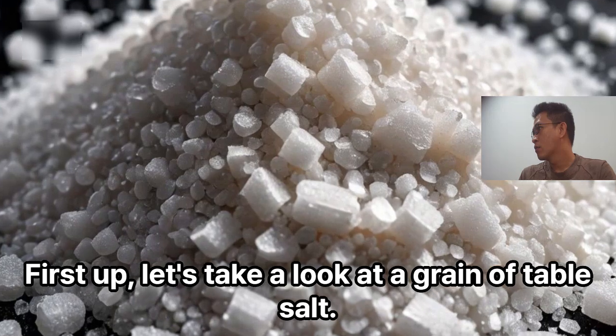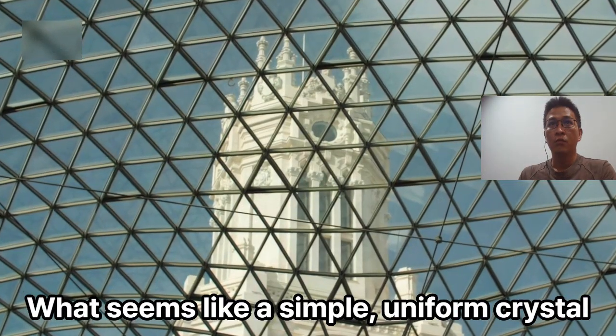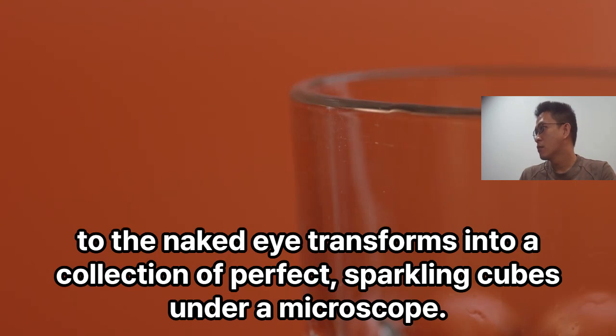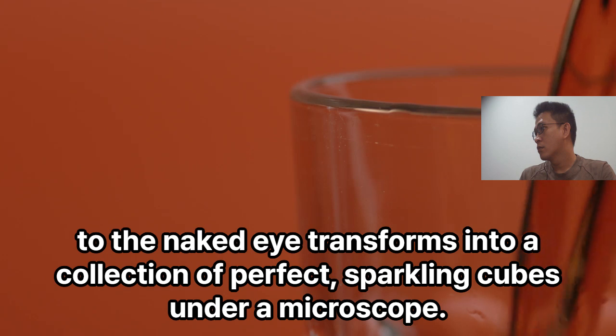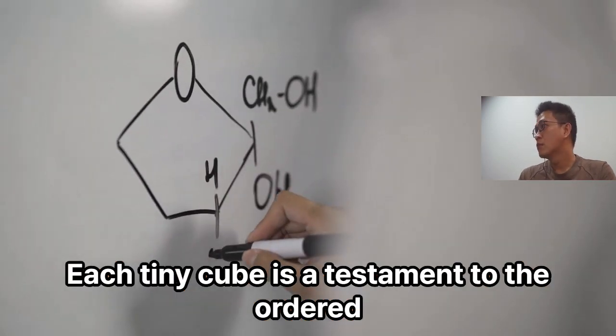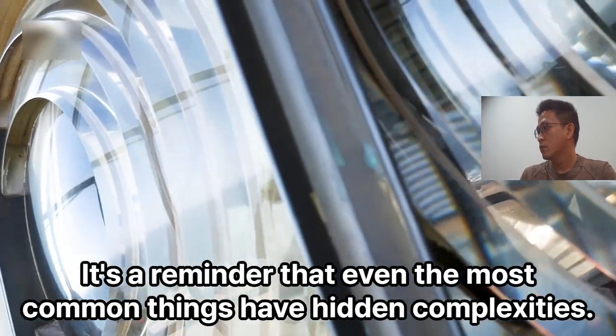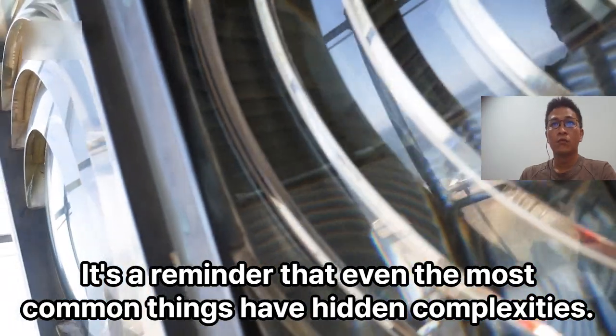First up, let's take a look at a grain of table salt. What seems like a simple uniform crystal to the naked eye transforms into a collection of perfect sparkling cubes under a microscope. Each tiny cube is a testament to the ordered structure of the salt's molecular bonds. It's a reminder that even the most common things have hidden complexities.